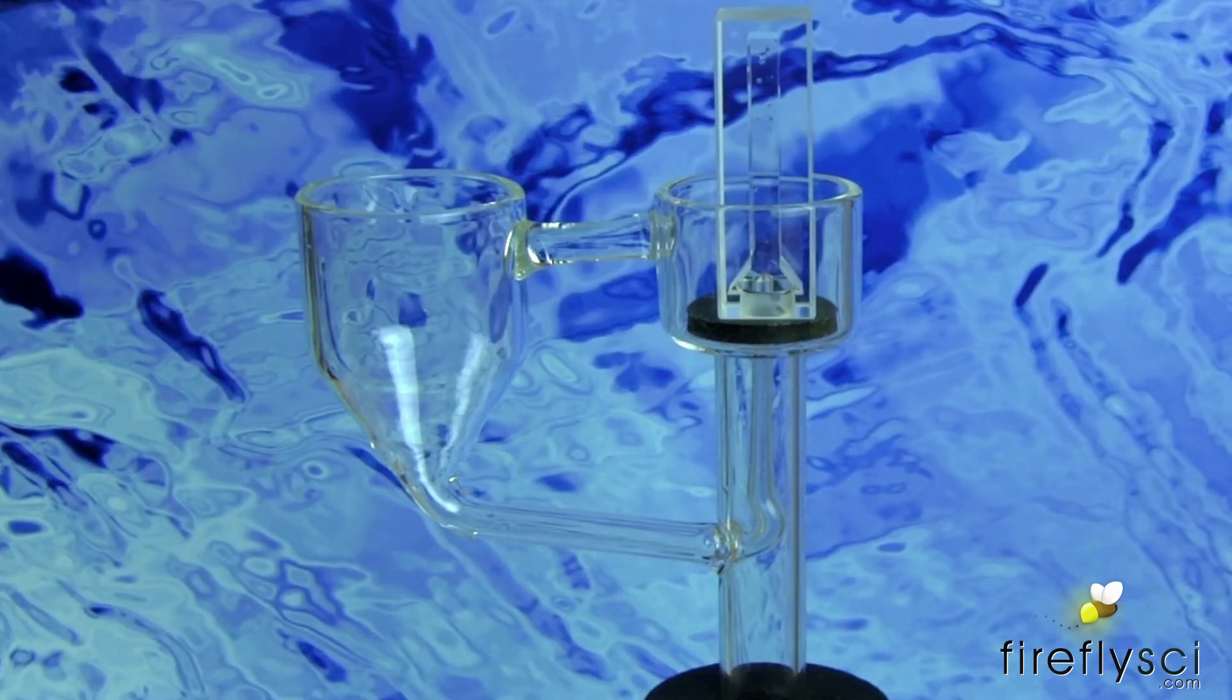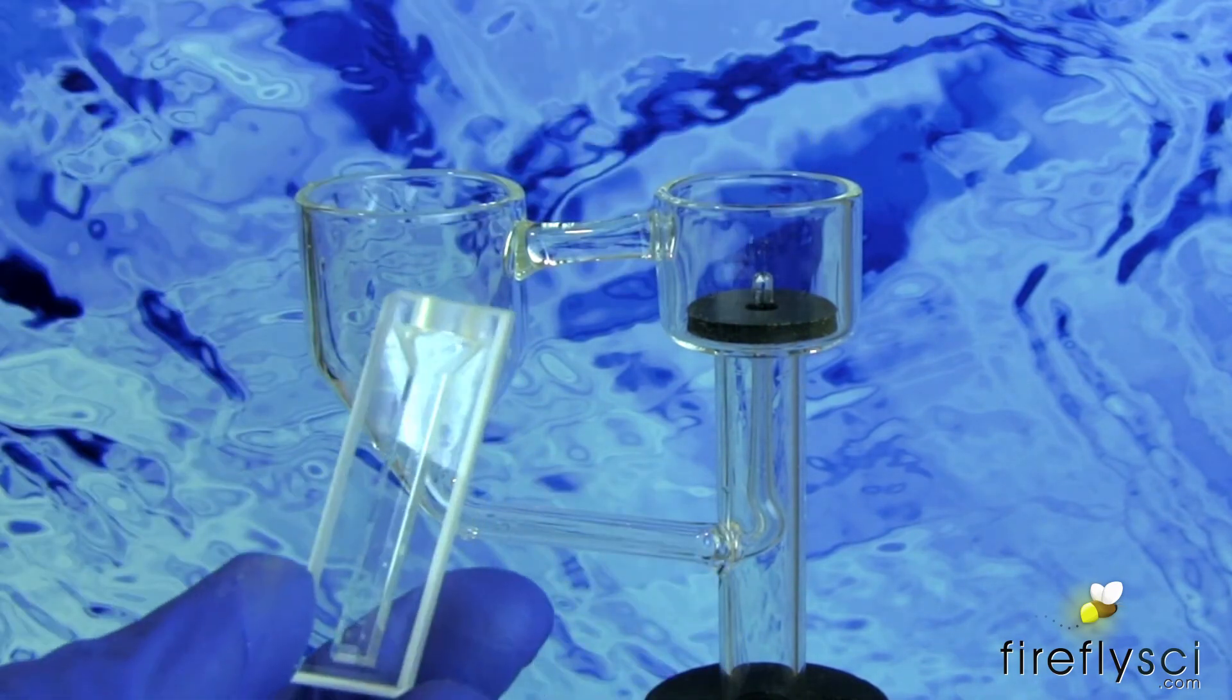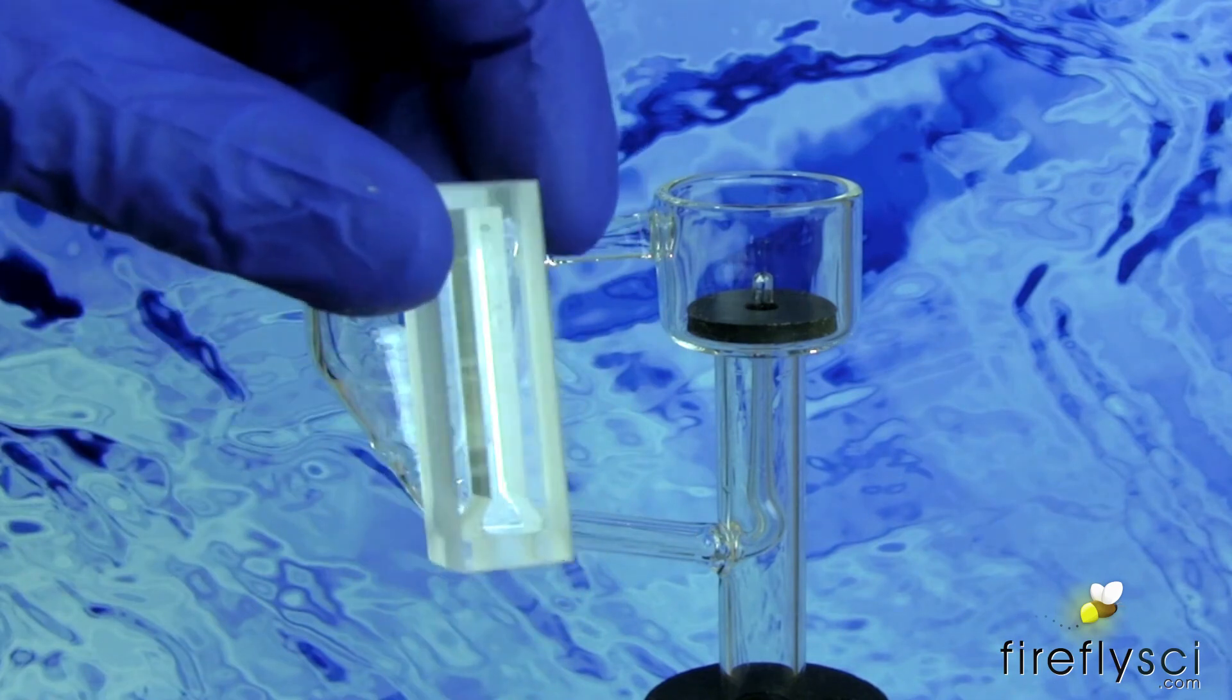Okay, so when it's done rinsing out the cuvette, simply take it off the top, and I'll put this upside down in the cuvette rack to dry so the excess water can drain out.